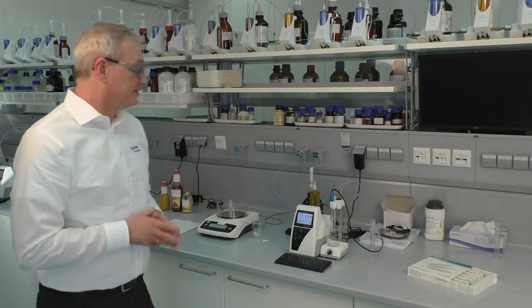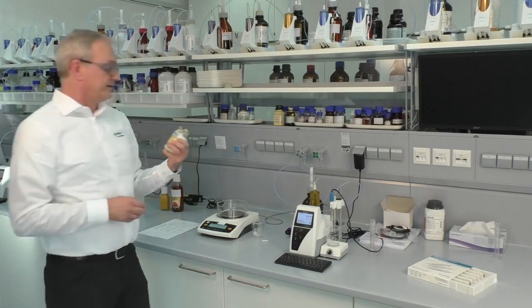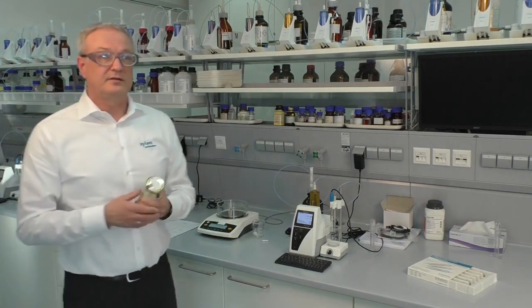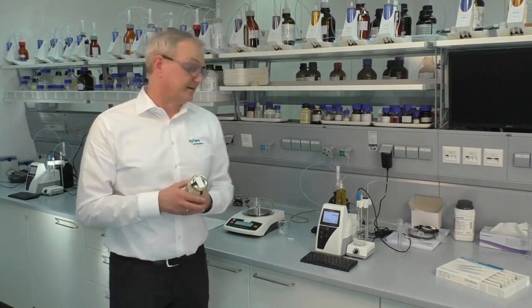In another video we showed you the titration of the total acidity in fruit juice, and now we will show you something different. We want to titrate the acidity in a mayonnaise, not a liquid. It's a more solid sample, and the difference is we don't have citric acid as in a juice. We have vinegar, acetic acid, in the sample.